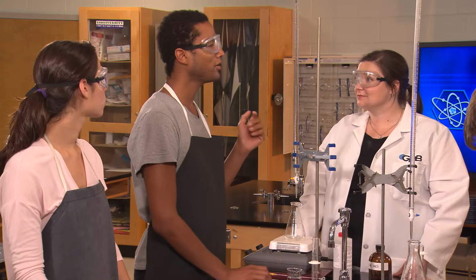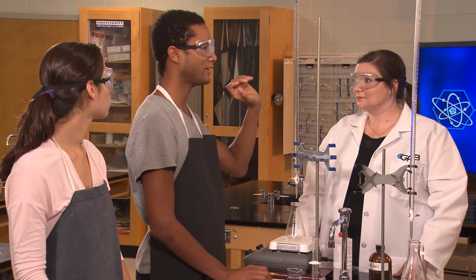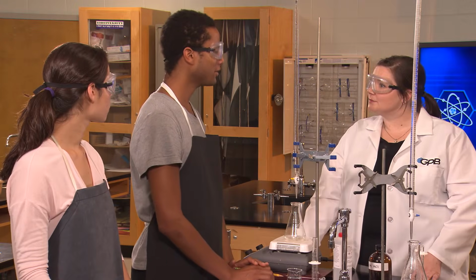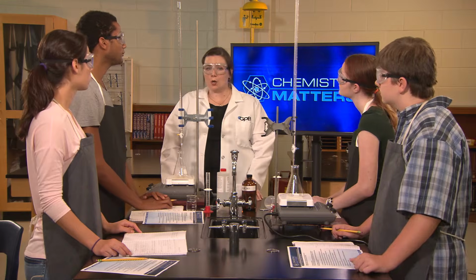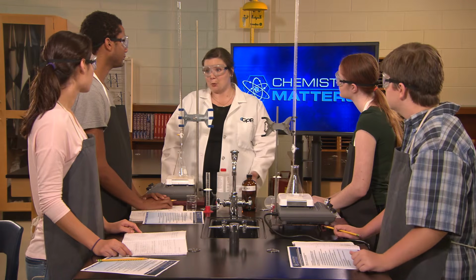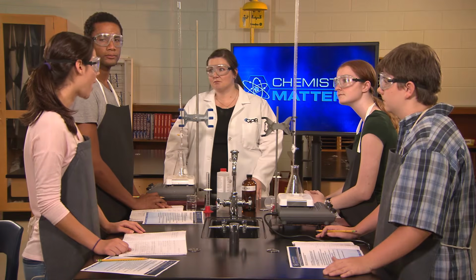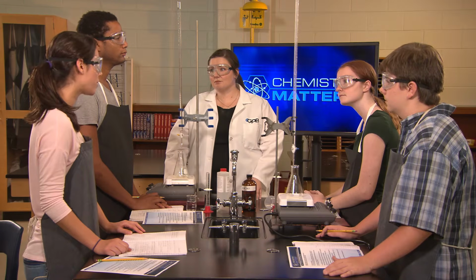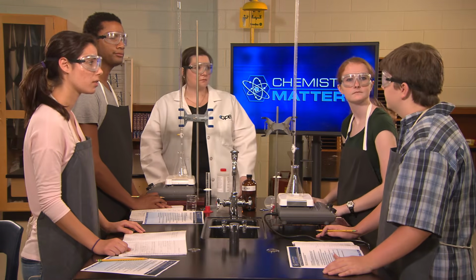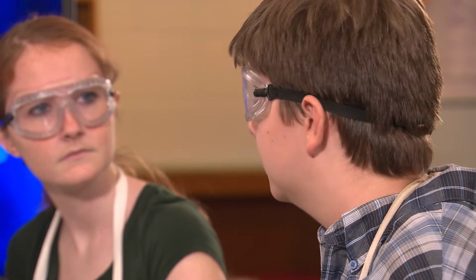I'll try. So we have this burette, and we put our standard solution of acid into it. Okay, what does that mean, standard? That we know its concentration. Very good. And I've already put 1 molar HCl in your burettes. So does it matter exactly how much I put in there? No, we just need to take an accurate reading of the volume of the solution before we start the titration. How about if we add 25 milliliters of the acid to the burette to start? Yeah, we'll take another reading of the burette after the indicator changes colors, and the difference in the volumes will be the volume that we used in the titration. Great.